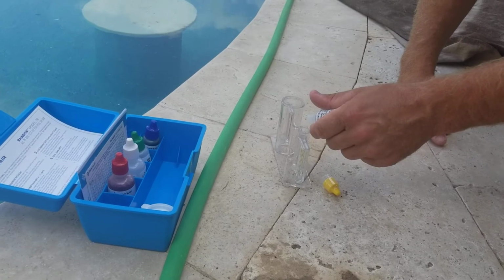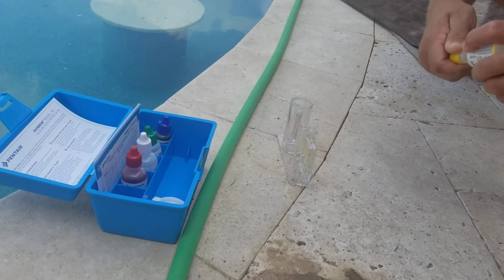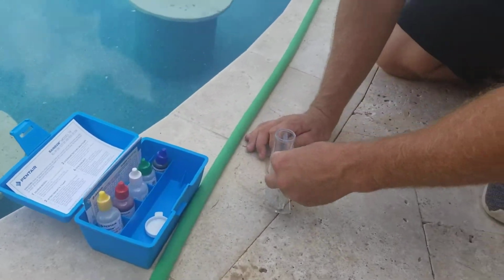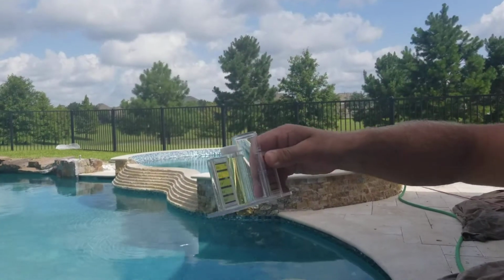1, 2, 3, 4. Yeah, there is chlorine in the water. I told you. Yeah, quite a bit. Wow. Told you. Maybe that's why it's not that bad. Yeah, they've said there's high levels of chlorine in our water. There is high levels of chlorine. I mean, you might not even ever have to add chlorine tabs.